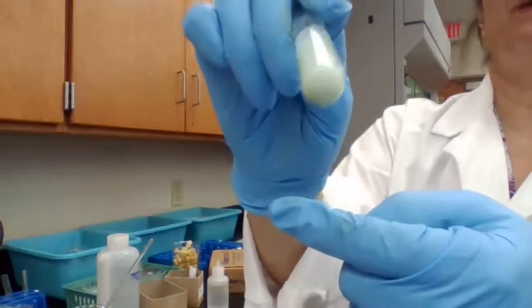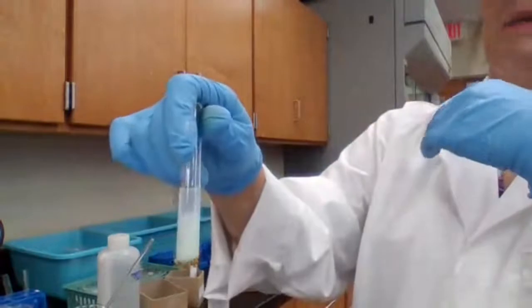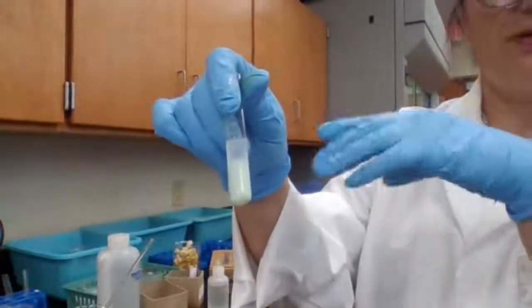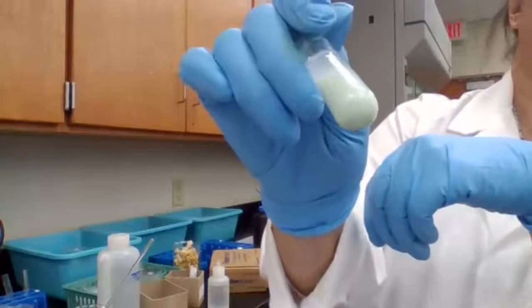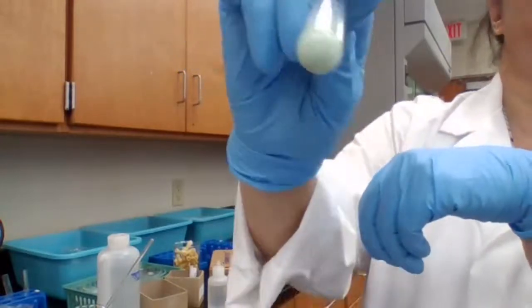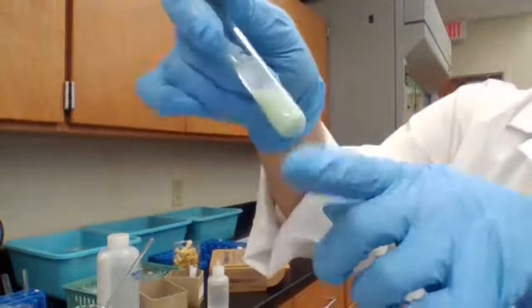Okay? It would be best for you to have a table ready, or have your lab notebook ready, and as you're watching, you record your observation, because you're not going to remember everything. So make sure you record your observation as you are watching the video. And the good thing is that you can replay it often. So the black particles here, that's the presence of bismuth.